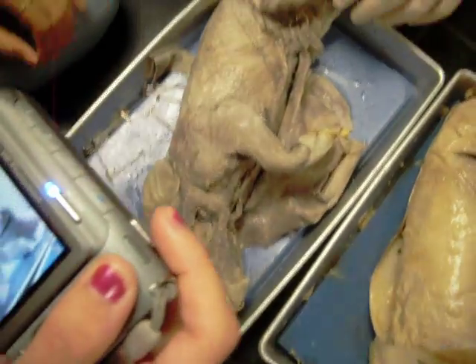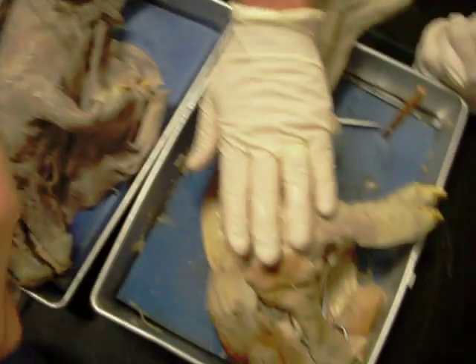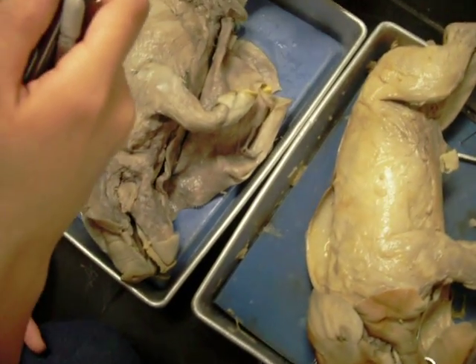Here we have a couple of fetal pigs. On the right hand side we have a female, and on the other side we have a male. We'll be using both of these for this particular tour.